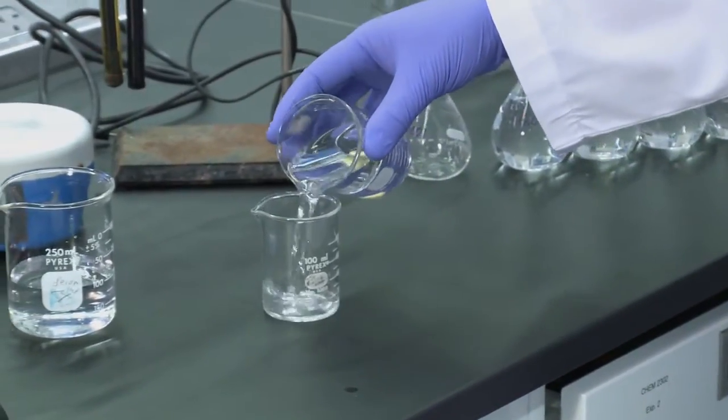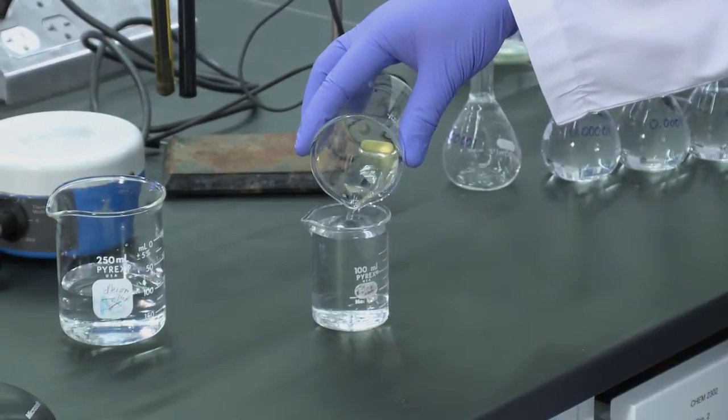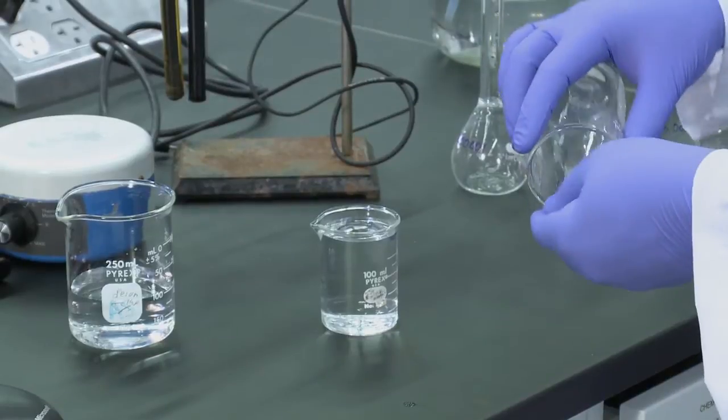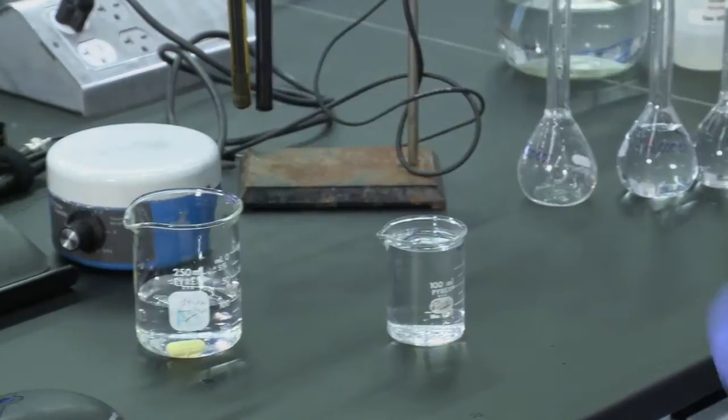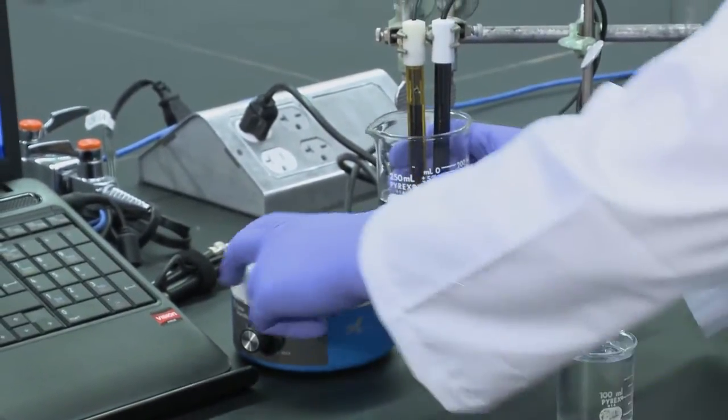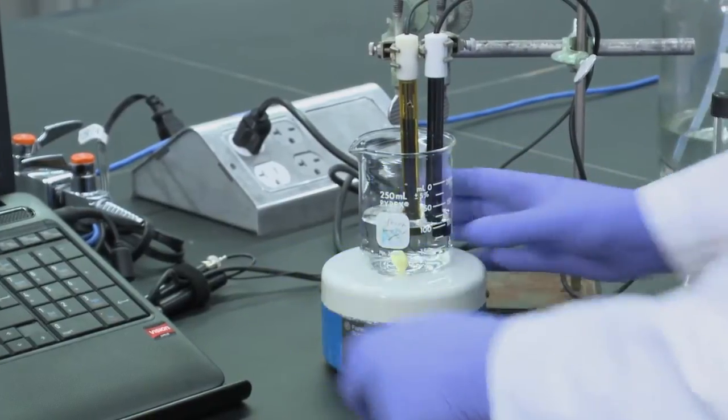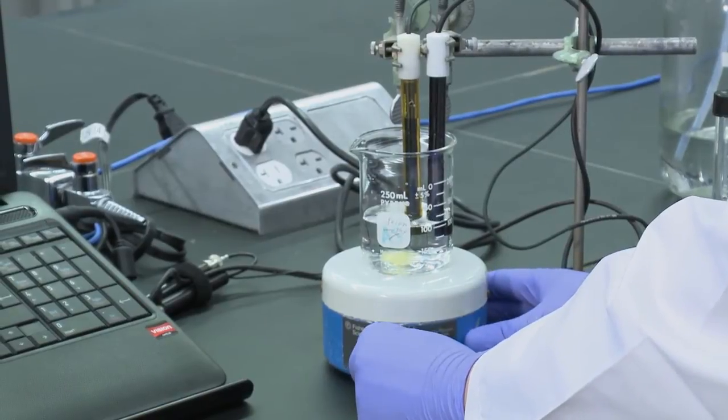At this point, we'll remove the magnet from the water and place it in our sample. We then place the sample back on the stir plate and set the stir plate to the same setting it was when we calibrated it.